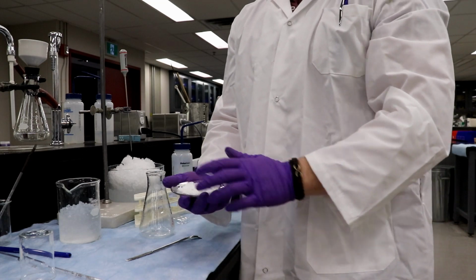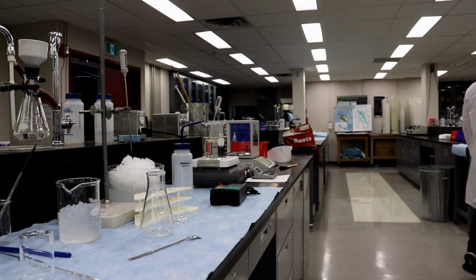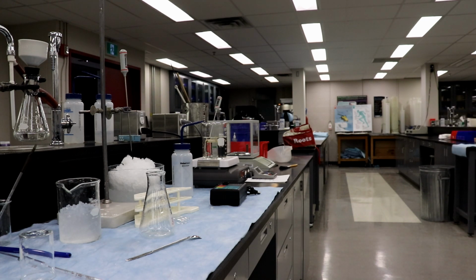Okay, oven. Where's the oven? The oven is in the back corner of the lab. Cool. It's the big oven with the duct tape on the one door, and you want to open the left door. Right door wasn't staying shut this way, it will stay at 100. It should be about 100 degrees in there.